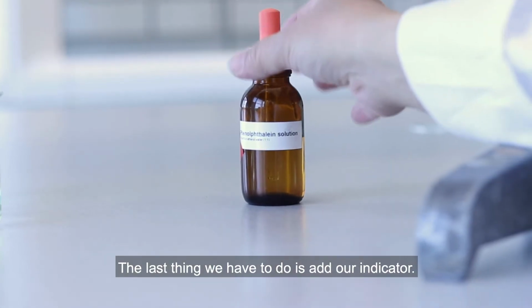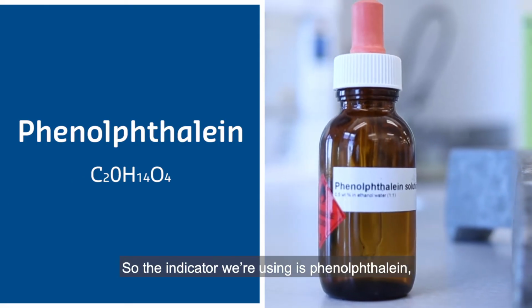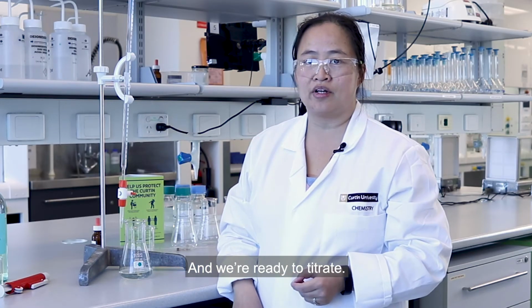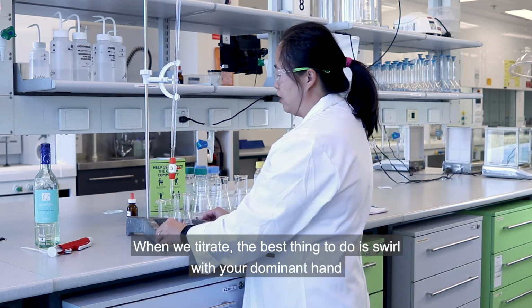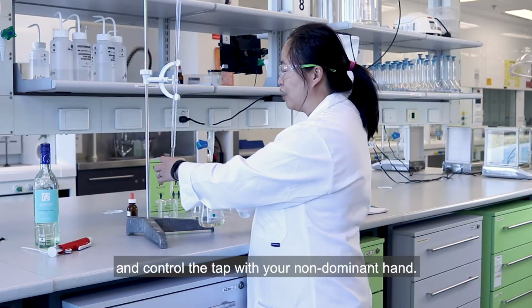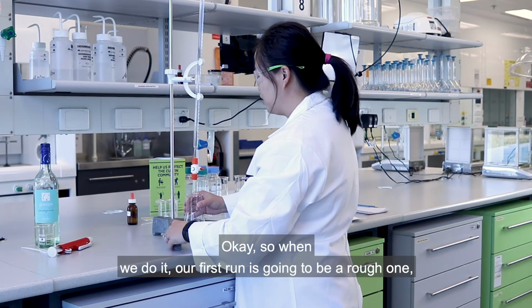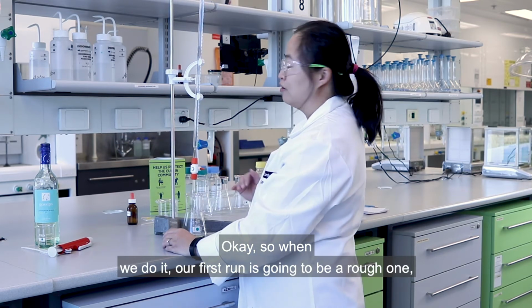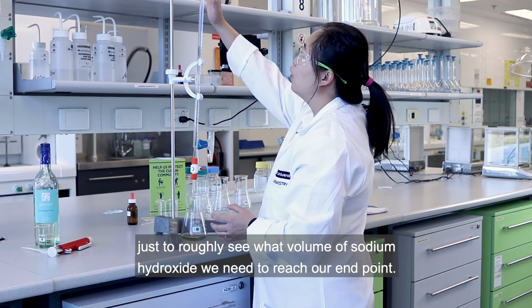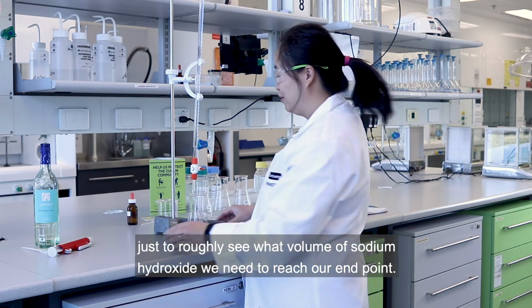The last thing we have to do is add our indicator. So the indicator we're using is phenolphthalein, and we only add 2 to 3 drops. And we're ready to titrate. When we titrate, the best thing to do is swirl with your dominant hand and control the tap with your non-dominant hand. Okay, so when we do it, our first run is going to be a rough one, just to see roughly what volume of sodium hydroxide we need to reach our endpoint.